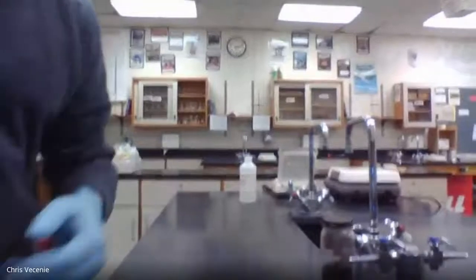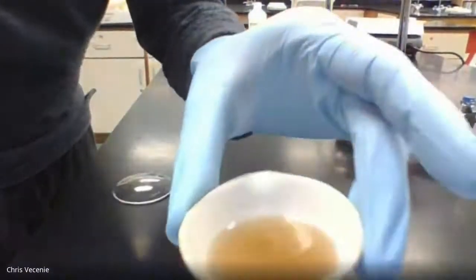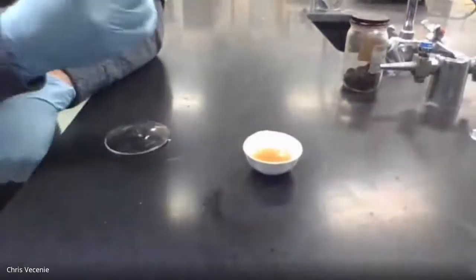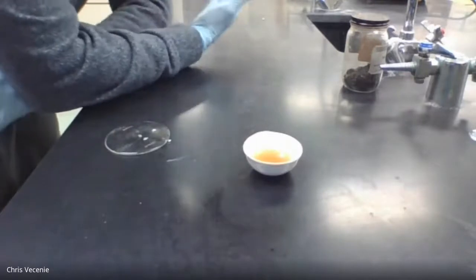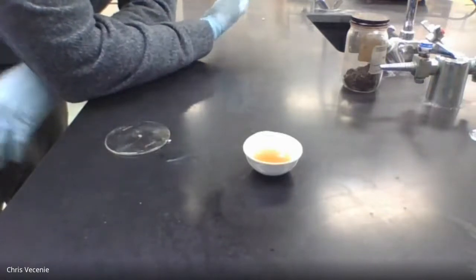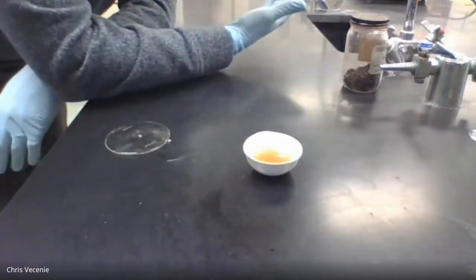So bring you guys back here. Tip this down for you. If you look in here, there is no more black solid. It has all been dissolved. It's now part of the manganese chloride product. And because the manganese chloride is dissolvable, you can't see it right now. What we need to do is get rid of all that liquid and convince it to come back out.